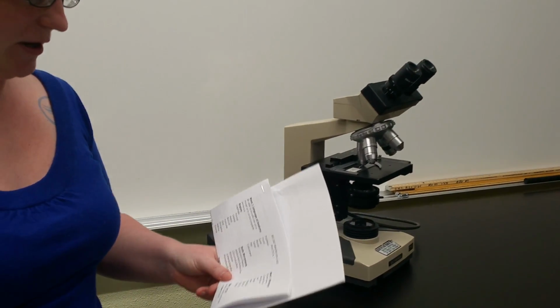All right, this is video number 5 for practical term sheet 1. We're still in week number 1. We got the microscope here. So I'm just going to try and go down in the order of the list.